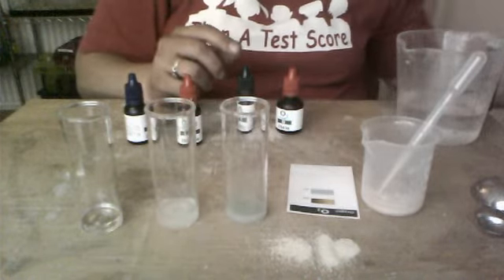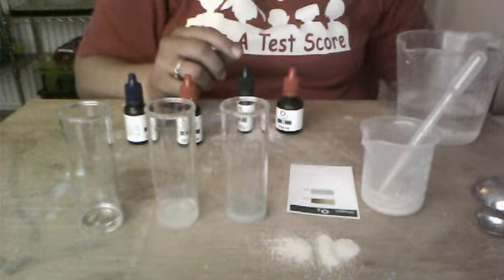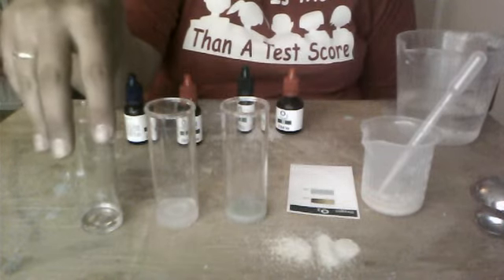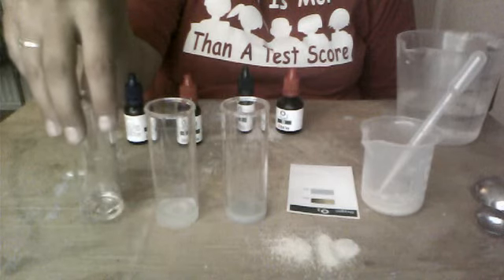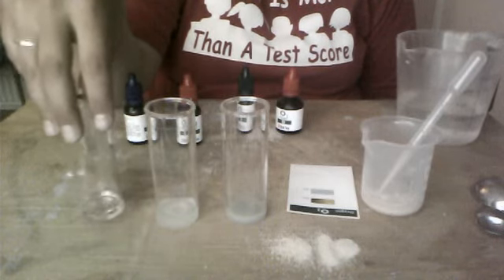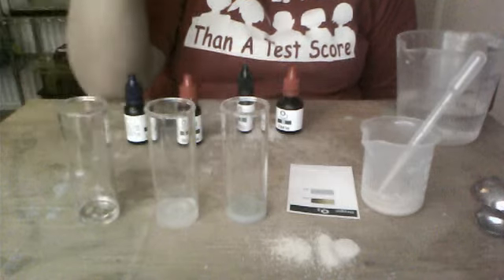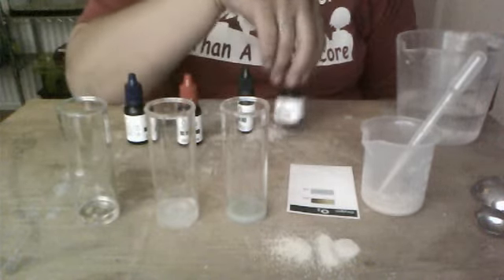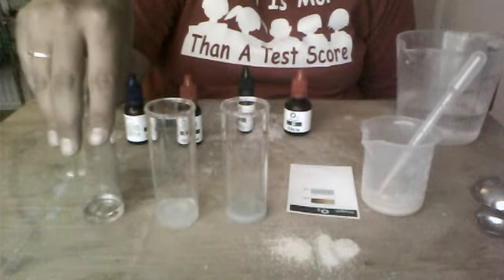So what does this mean? When you answer question 2, you're going to be thinking about what does this mean? And I'll just review for you really quickly. We have in our control 6 milliliters of water. There's no yeast in this jar, but it does have all 4 of the reagents, and it took 6 drops of reagent D in order to turn test tube 1 blue.